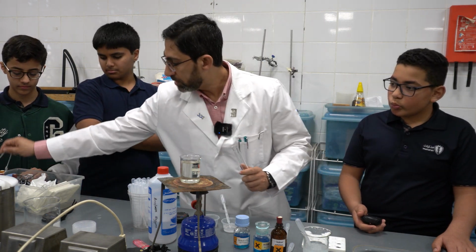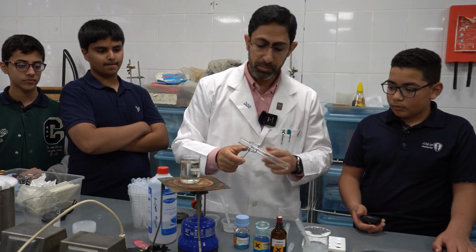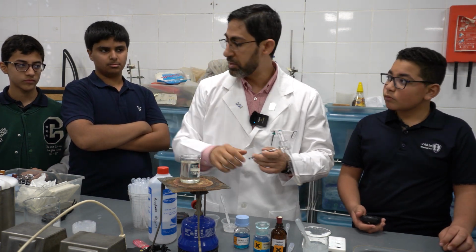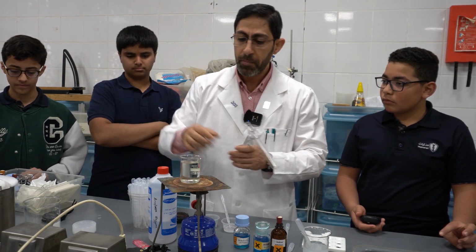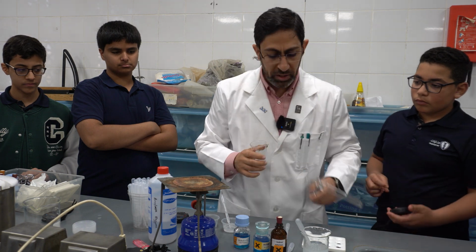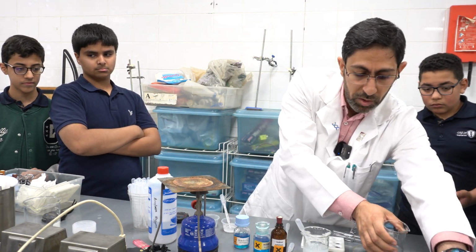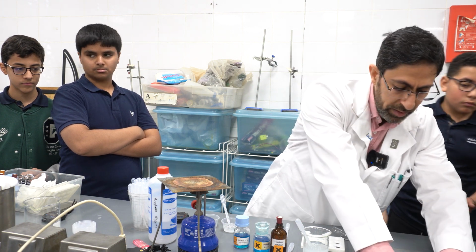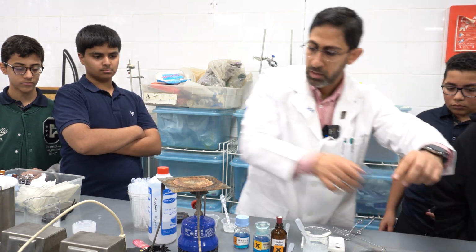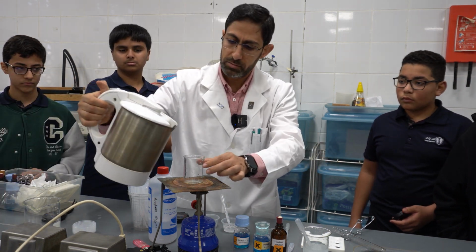We're going to use the tongs as a safety precaution. I should have the goggles, but I don't have them today. So we should have a water bath, and I'd prefer the thermostatically controlled water bath, but for today we do not have it. So we will use, I have here hot water. I can make use of it.